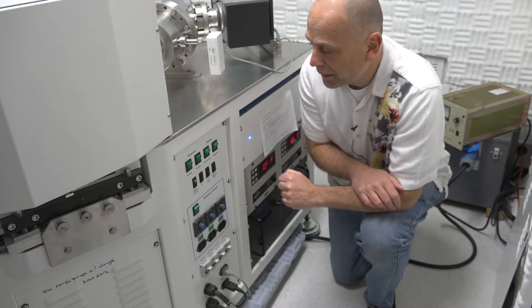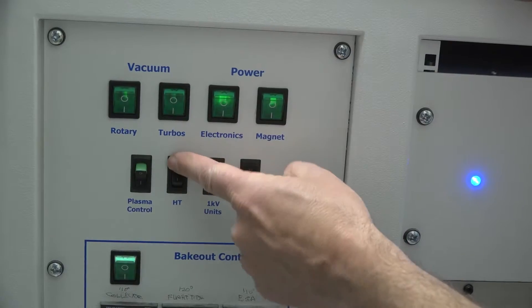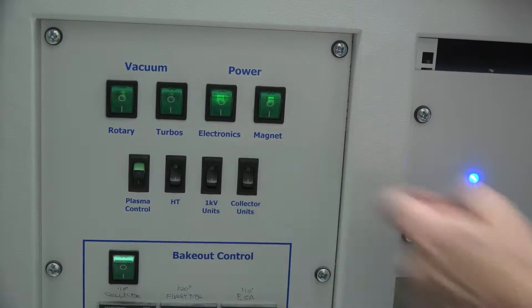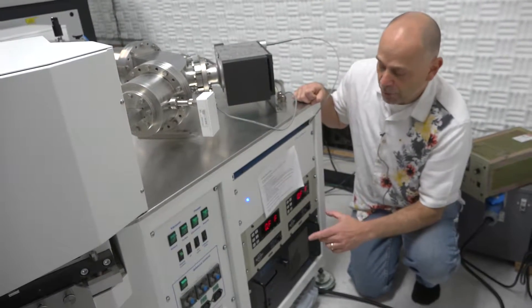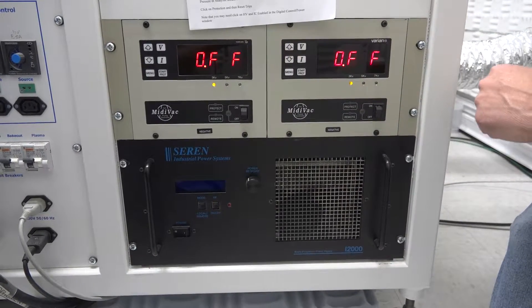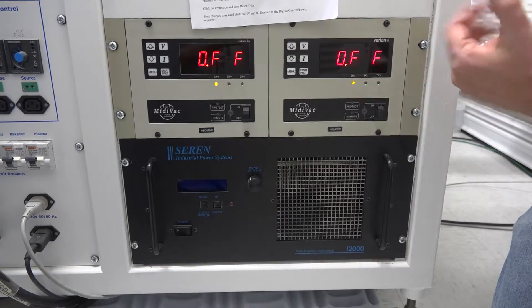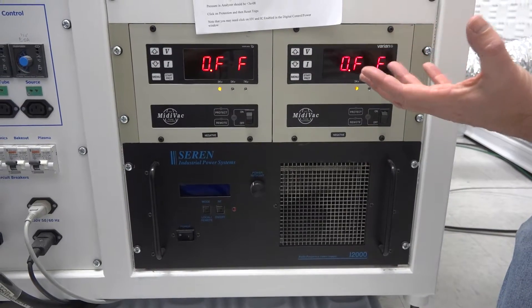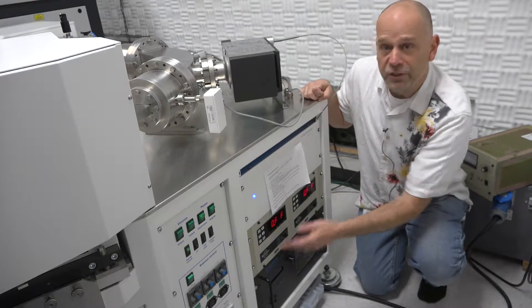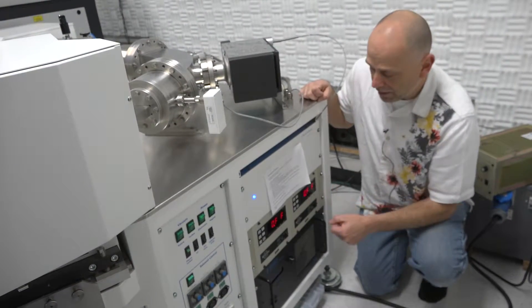Here at the back panel of the instrument, HT, 1KV and collector units all need to be off. The ion control units also have to be off, done by a simple switch on the front of the control unit. In our instance, they were already off because we just changed out an ion pump yesterday. But if you're just baking out, just ensure that these units are off.